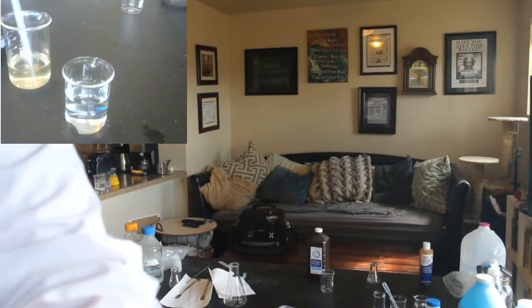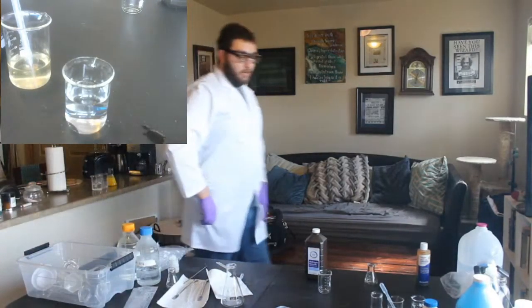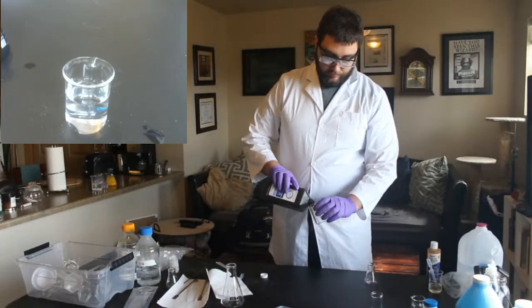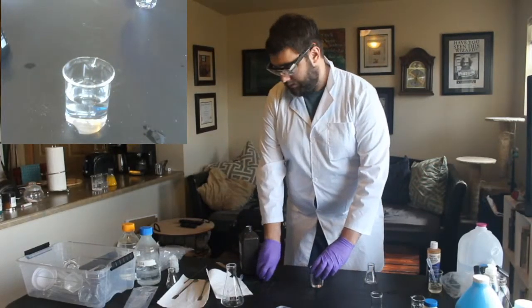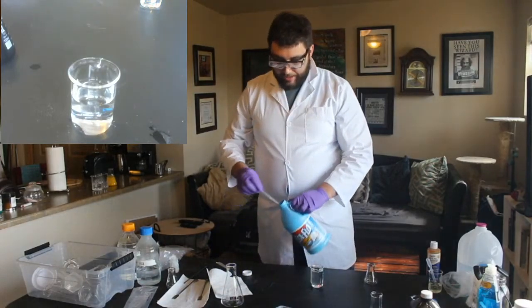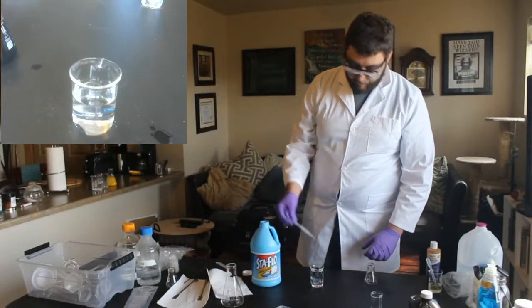Great questions, though. Okay, I'm going to move us back here. Yeah, it's not letting much light through at all. So we're going to create another hydrogen peroxide and starch solution. I have more hydrogen peroxide, so it's okay if we're out. And maybe I'll add a little bit less starch this time. It will be a little bit less dark, but the reaction will still happen.